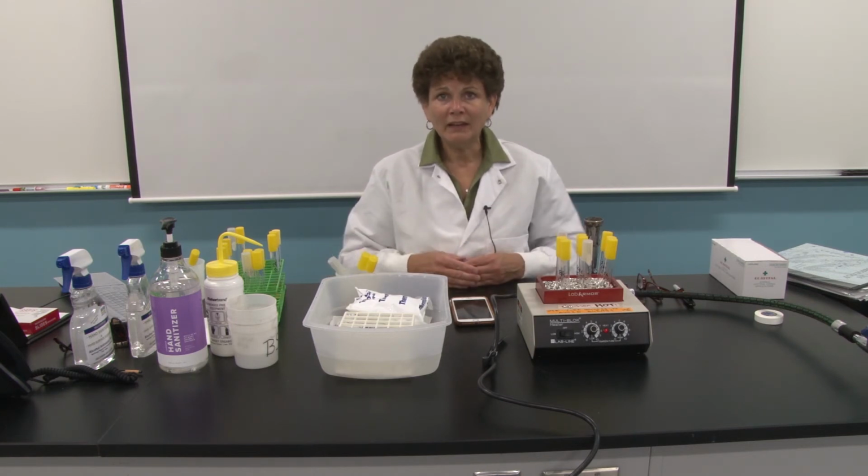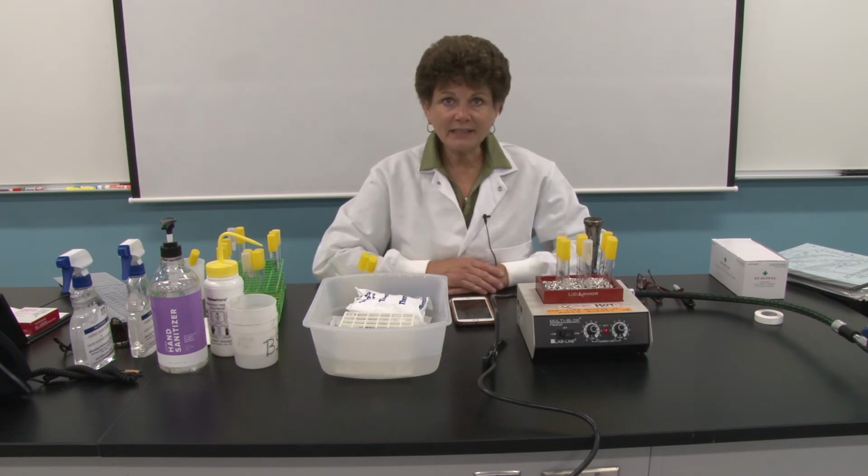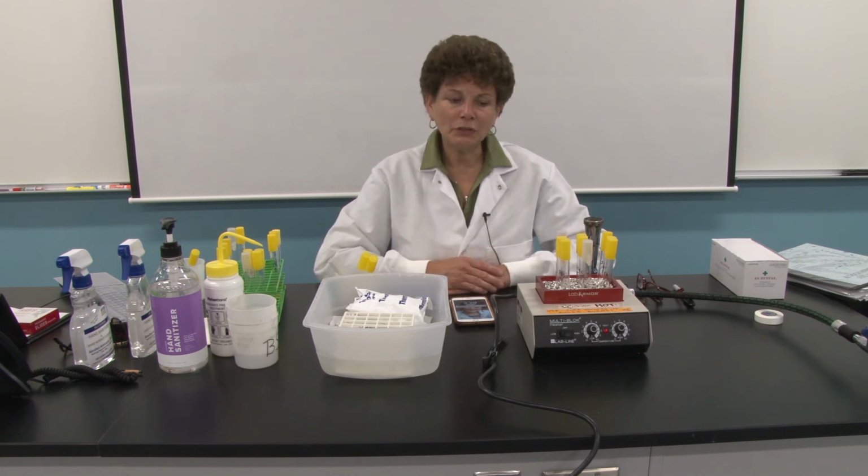What we were actually doing was killing bacterial spores. 121 degrees Celsius is extremely hot, and boiling water at sea level is only 100 degrees Celsius, 21 degrees cooler than the autoclave. So the question we have today that we need to address is, does boiling actually sterilize? Can you increase the length of time you boil something at 100 degrees, and thus sterilize and kill bacterial spores? Or is it more likely just a disinfectant? Or can it be both, depending on the length of time you boil something?